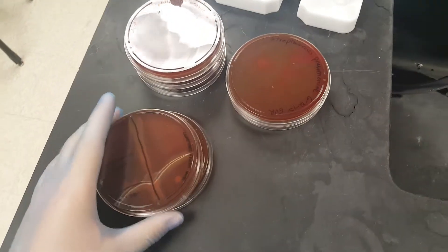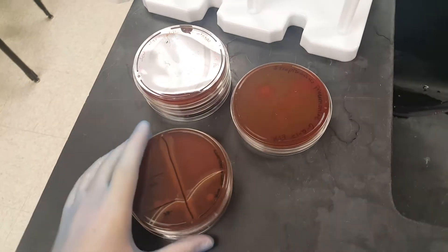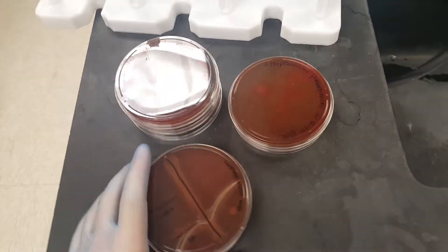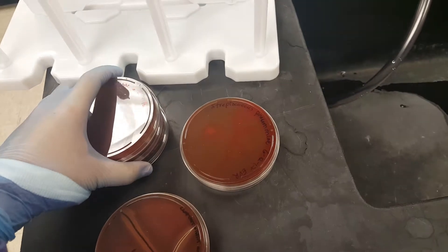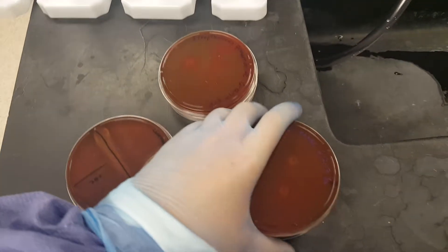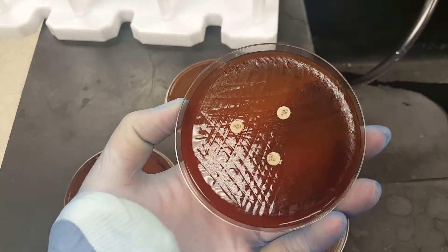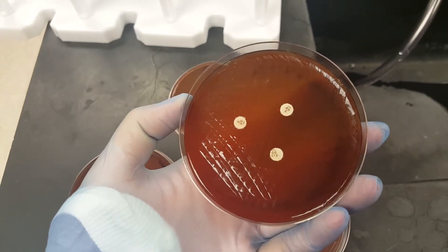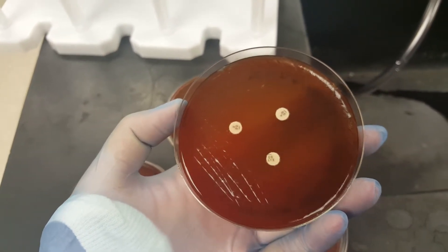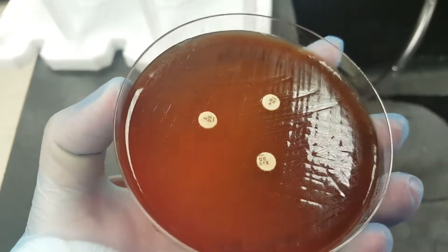Today we're going to be talking about the CAMP factor and susceptibility testing. In our lab we have three Haemophilus species that we do testing for: Haemophilus influenzae, Haemophilus parainfluenzae, and Parahemolyticus. We did a test to see what organisms grow and need the X factor, V factor, or both. X factor is hemin, V factor is NAD, and obviously if they need both, then it's both of them together.